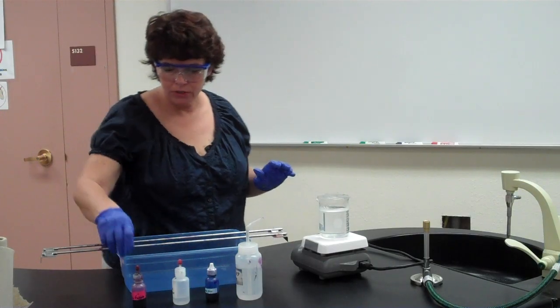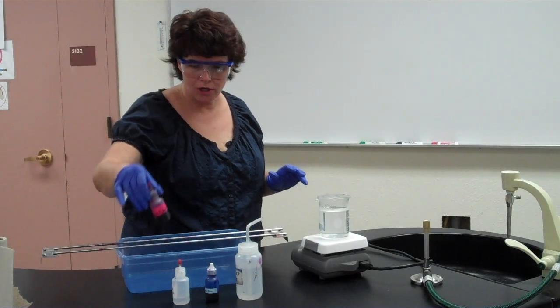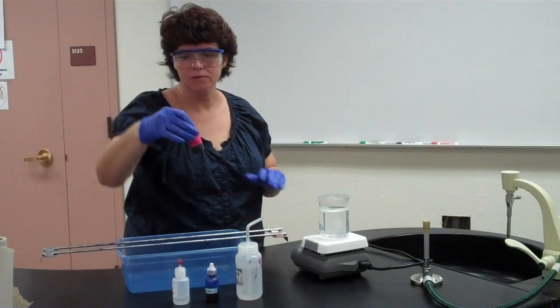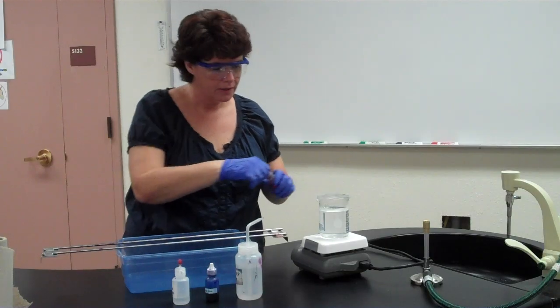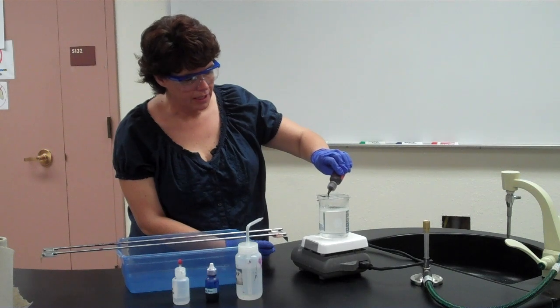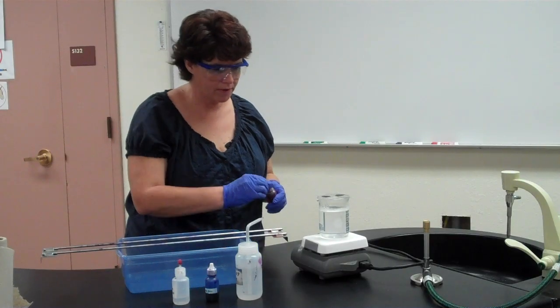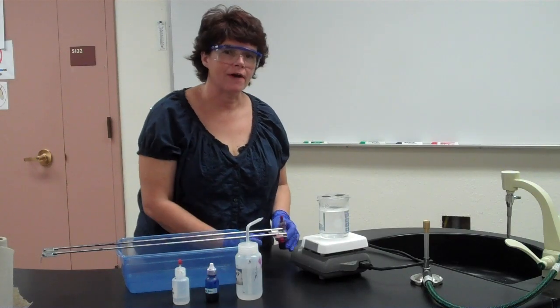Okay? Now when you go to add the stain, the primary stain of the acid-fast stain is the carbol fuchsin. Okay? We saw this when we did simple staining. So what we're going to do is add the carbol fuchsin. Add just enough to cover where you think the smear is, where your circles are, but try not to drop too much of it in the water. Now that's going to steam for 5 minutes.